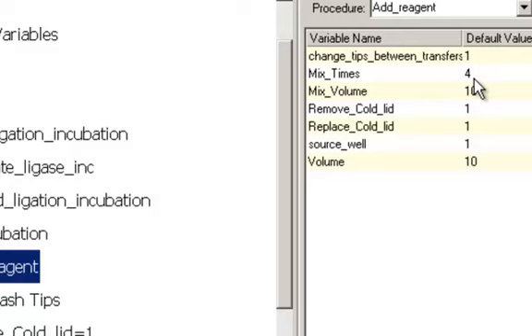so we always change tips. Should you mix after you do the transfer? If this is set to a number above 0, it'll mix, and here we have it set to 4, and it will mix 4 times. Here is the mix volume. How much will it aspirate and dispense each time it mixes? When you call this add reagents, do you want it to remove the lid from the cold block before you do the transfer? If the lid is already off the cold block, you don't have to set that to a 1. You can set it to a 0.